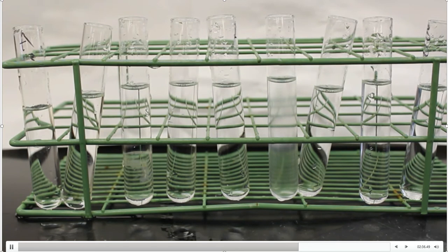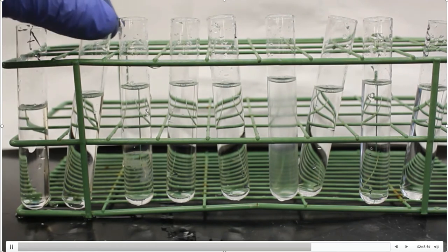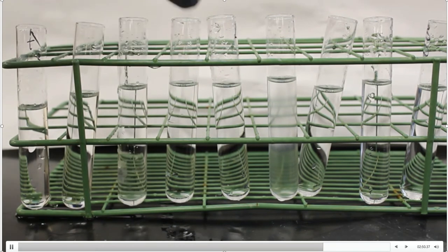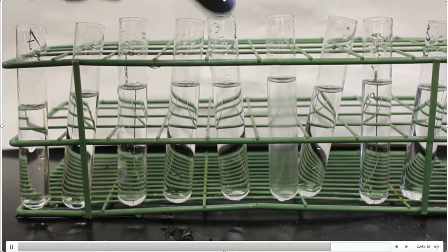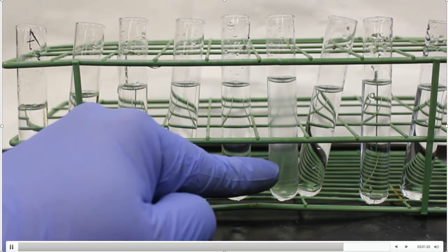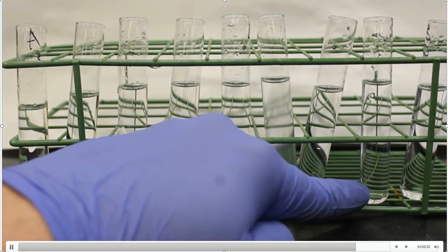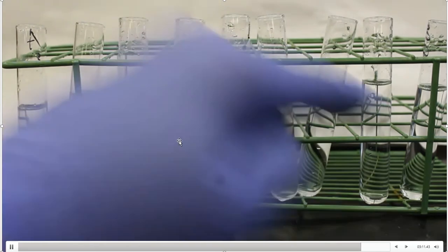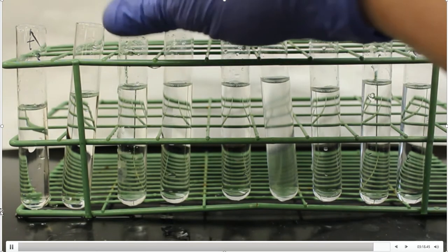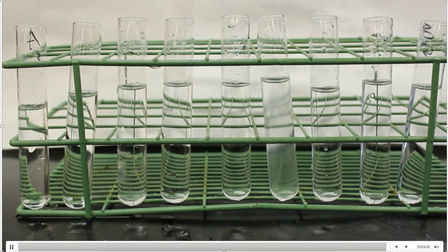Let me go through the identities of each of these solutions because they are somewhat out of order, just like some of the other tests were. The very first test tube is maltose. Then unknown number one. The next is lactose. The fourth is unknown number two. The fifth is xylose. The sixth is starch. The seventh is fructose. The eighth is glucose. And the ninth is sucrose. Seliwanoff's will change color and tell me what type of sugar we have — either an aldose or a ketose. Into the water bath they go — two and a half minutes.